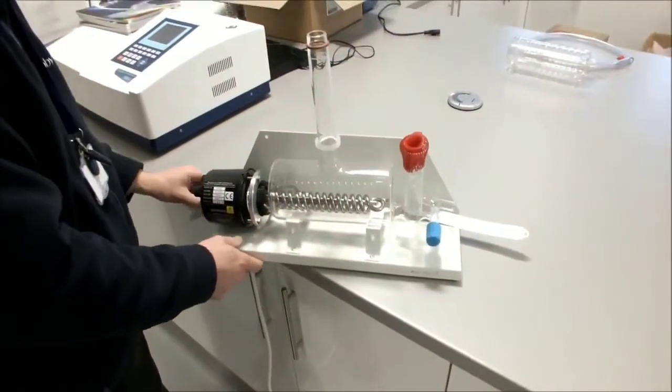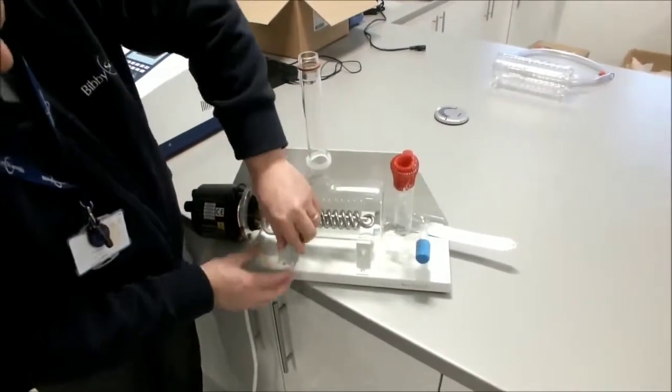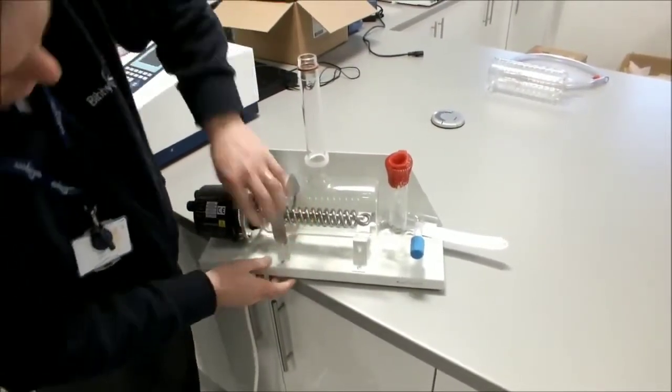We then place the heater and the boiler assembly onto the cradle. We can then take our straps to the front and connect the straps to the front like so.